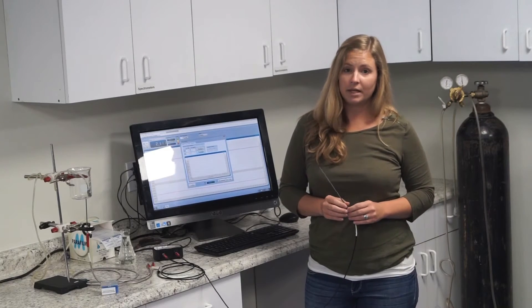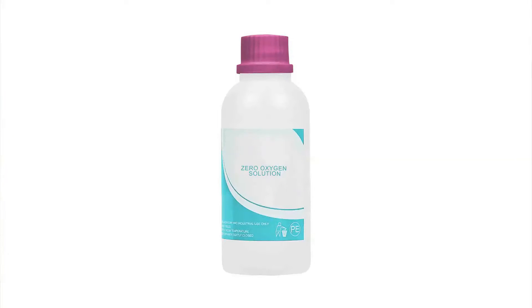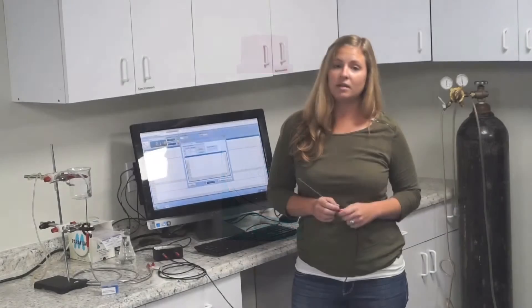For the second point, you're going to need a tank of nitrogen or helium for your 0% oxygen reference. You can use a 0% oxygen liquid reference, but these liquids can become contaminated over time with oxygen and they will not be the best possible reference for your zero point.